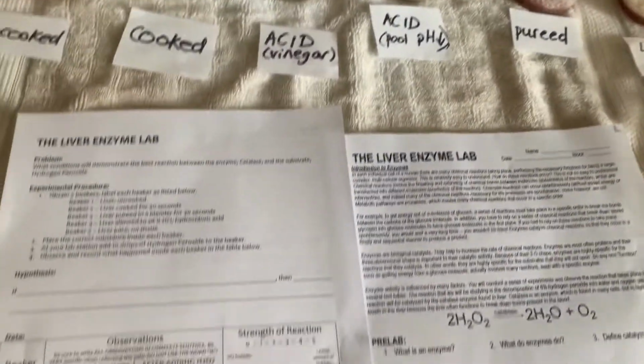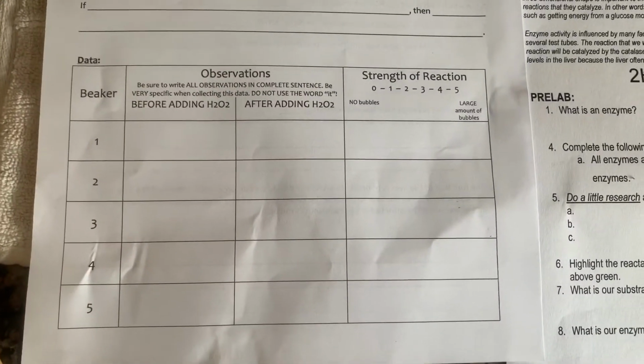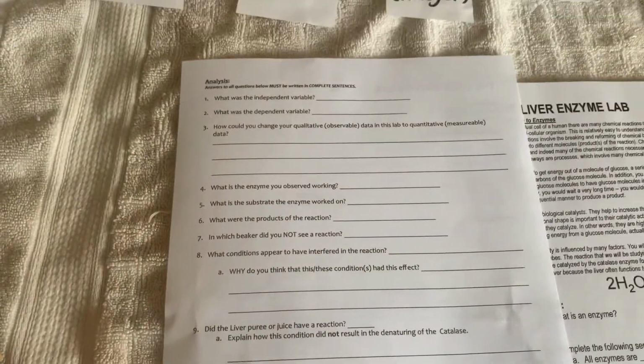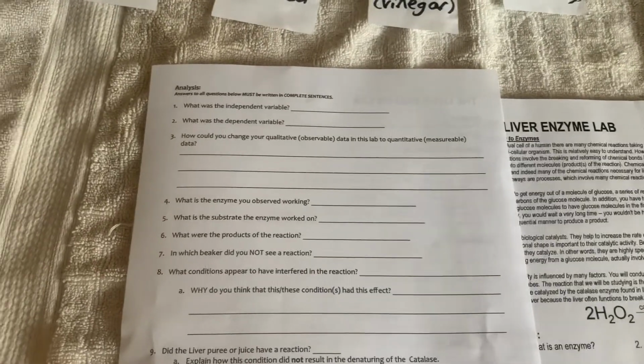I want you to fill out the columns here, and on the back of this sheet there's a bunch of questions I'd like you to answer. And oh my goodness me, I'm going to take these goggles off because they don't make great safety wear, because they're all steamed up and I can't see much, but at least I didn't get any acid in my face.